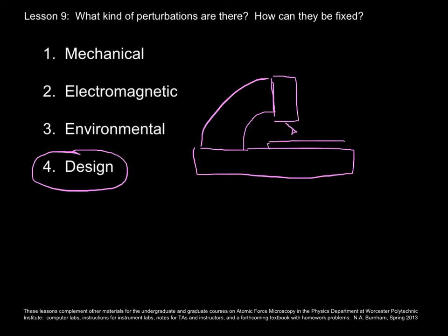And the reason why it's done this way is because now we can have a motorized stage down here with an 8-inch silicon wafer there. That motorized stage allows you to go to several places on that silicon wafer and check for roughness. But the problem is that even though these pieces are big and stiff and you don't expect them to vibrate, again, we have an extraordinarily sensitive instrument here. And this arm wiggles up and down like that. So much so that it would be unrealistic of me to expect better than 2 angstroms of noise.